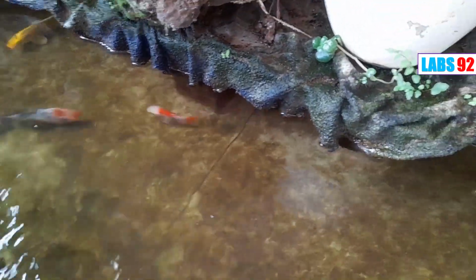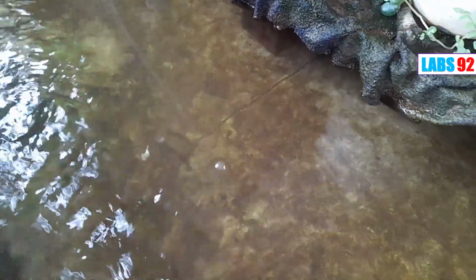Today we go to the garden and visit a fish pool. This is a koi fish pool. Koi is a Japanese fish. They have many beautiful colors. We usually clean the pool every day and use an oxygen pump to help them breathe better. And now we are going to check if the water is totally clean.